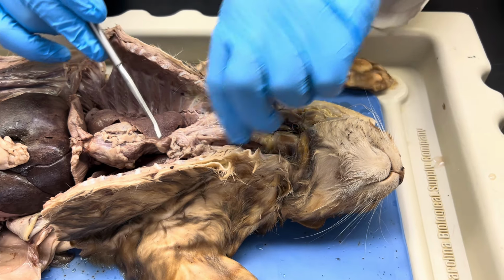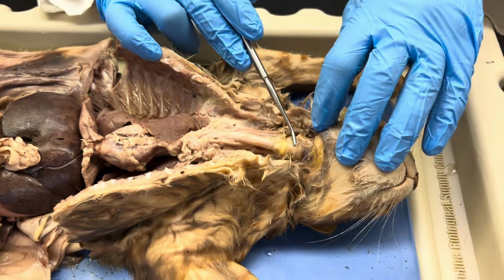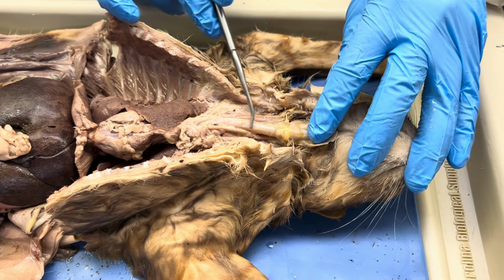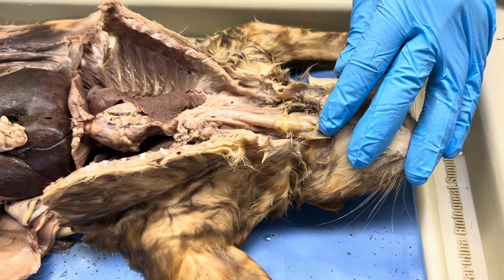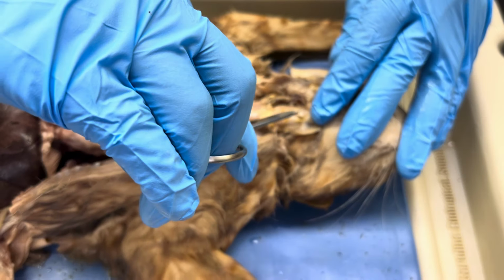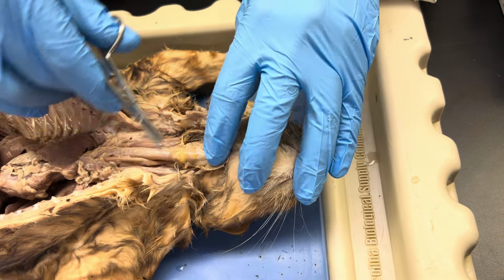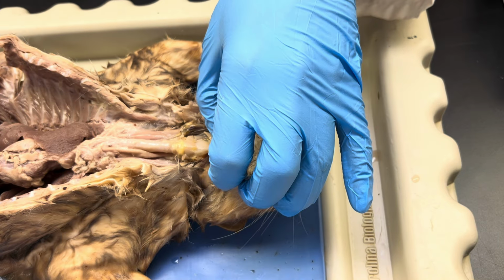Now, another structure that you have, it's a little out of order, I think, but toward this superior margin of the trachea, when I say superior, I mean the top. See, we come up. Right here, there's a little cartilage-based box. I'm gonna see if I can dissect this out just a little bit. Kind of clean it up maybe so y'all can see it. So just had to snip a little bit right there.